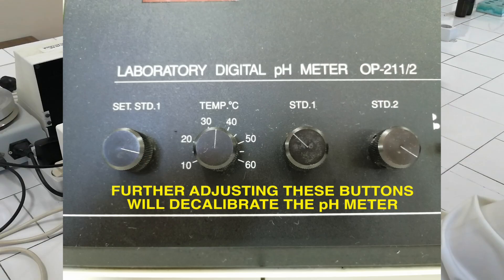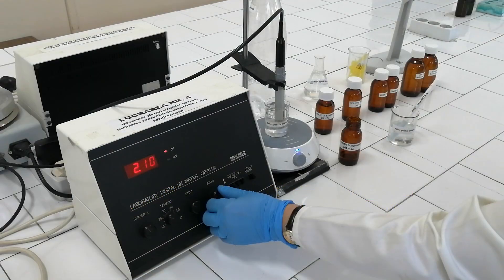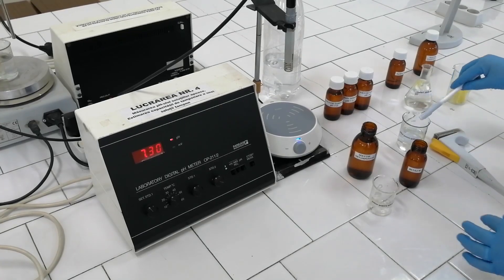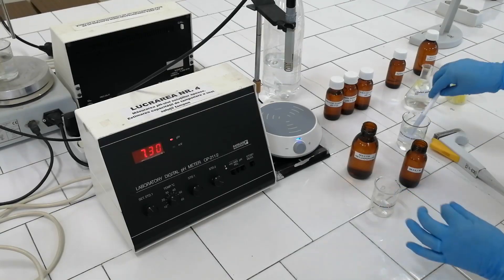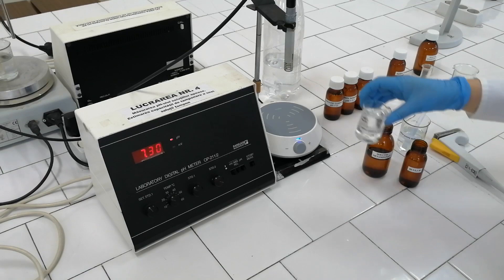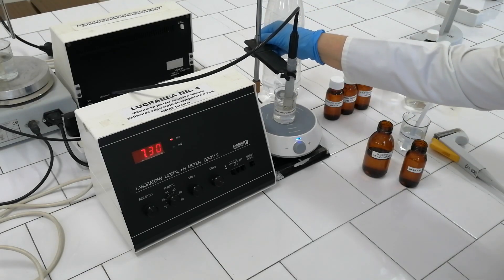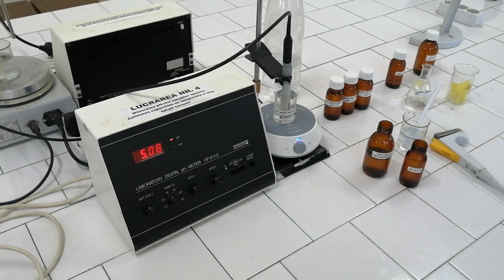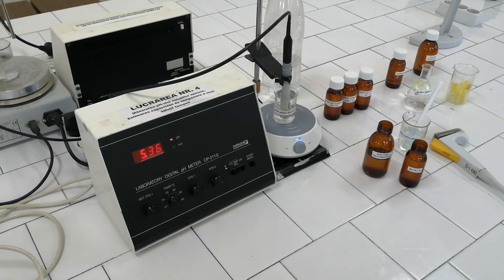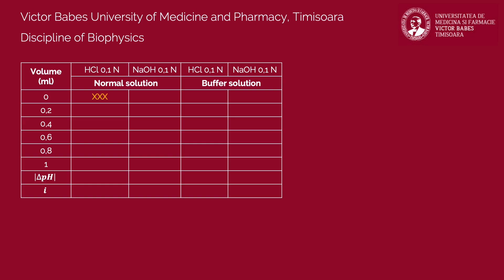Don't change the position of buttons SET STD1, TEMPERATURE, STD1 and STD2 to prevent miscalibration of the instrument. Pour the non-buffer solution into the measuring glass, add a clean magnet inside, turn on the magnetic stirrer, and place the beaker on it. Dip the electrode into the solution and set the pH meter in measuring mode. After approximately one minute, measure the pH of this solution and record the obtained value in the table.